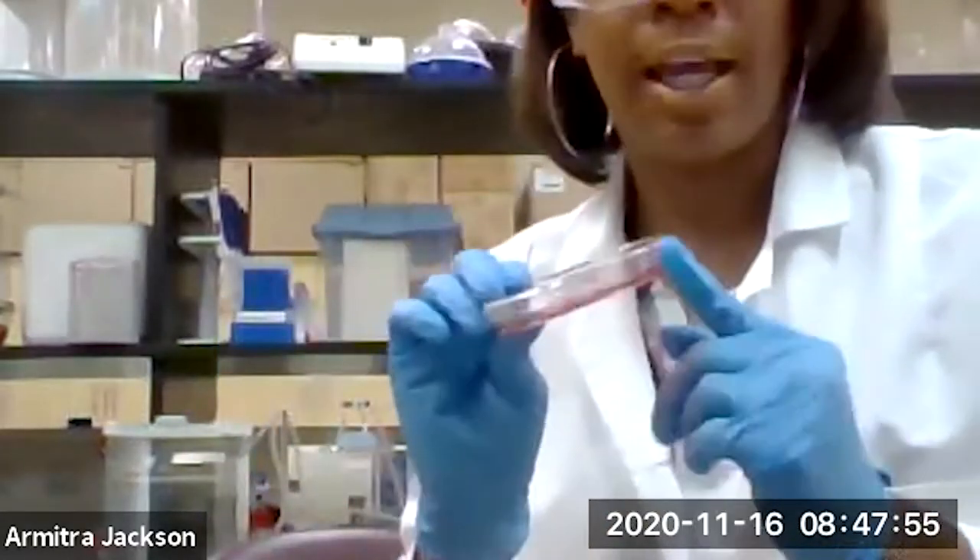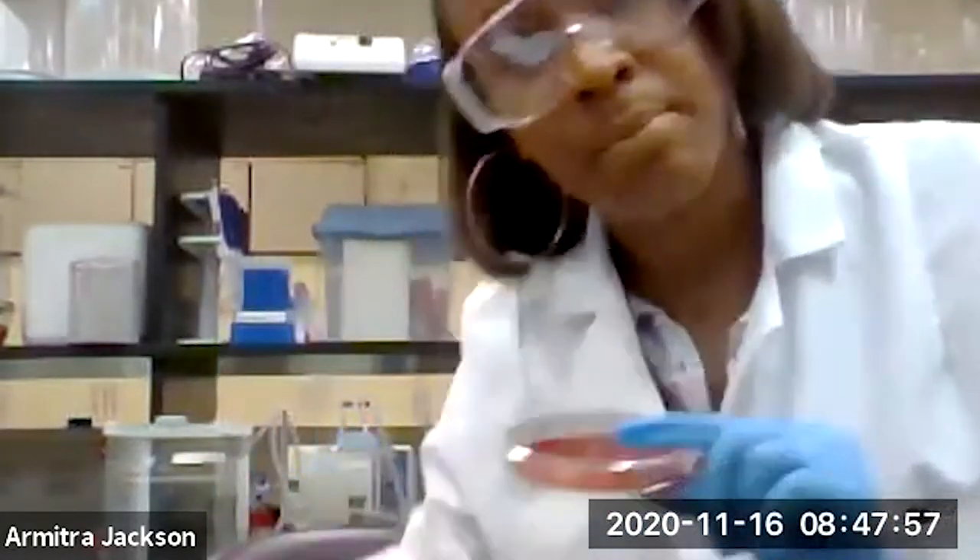Take that plate — be sure you label it with your name and the date that you actually took the sample, for those who will be bringing it to the lab for us to process.